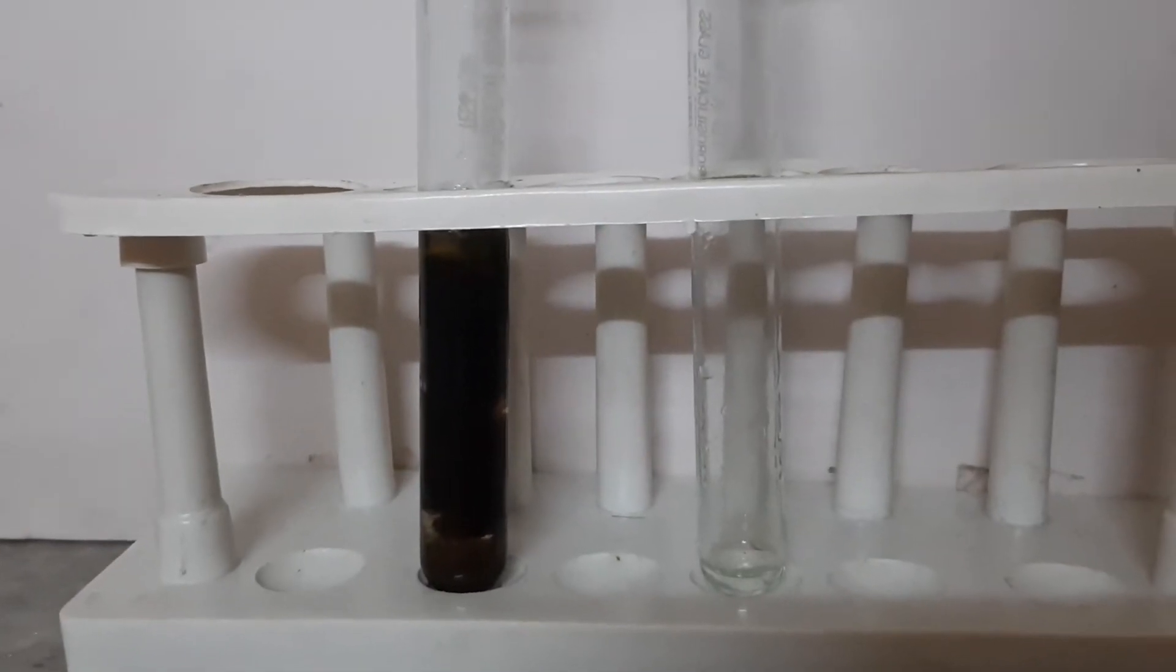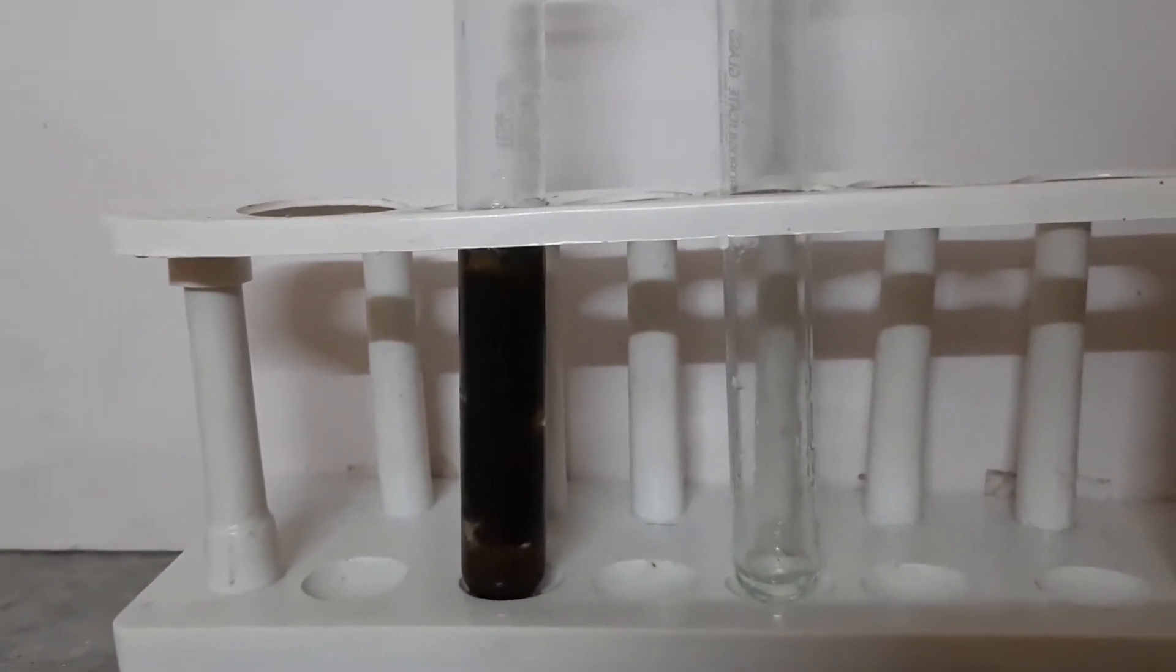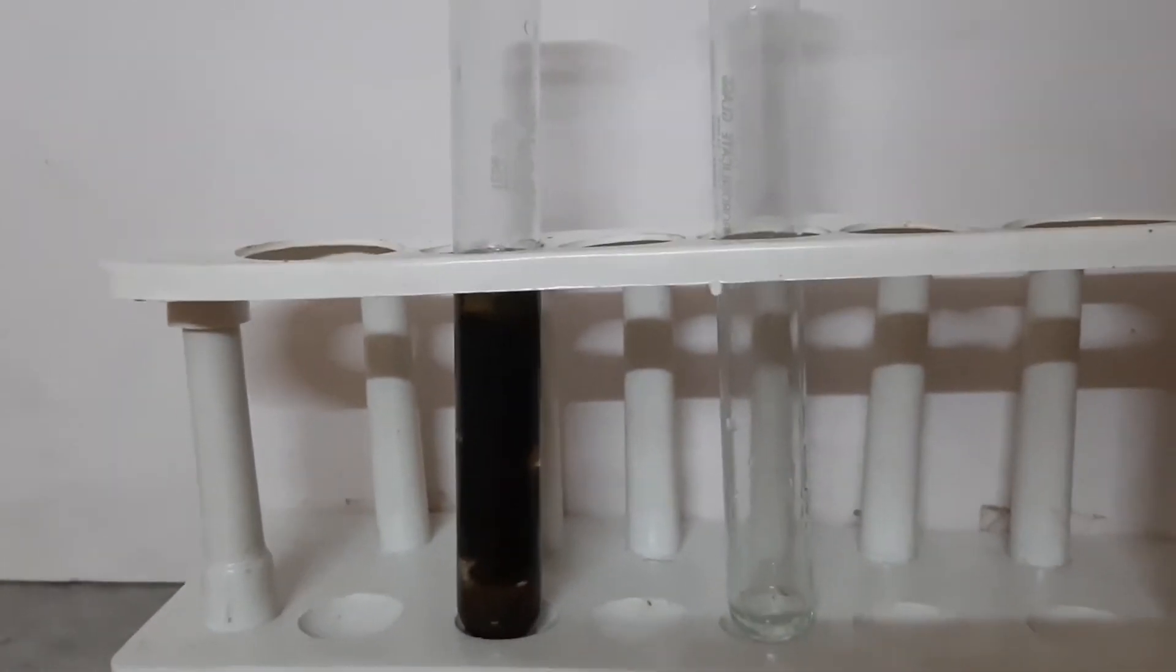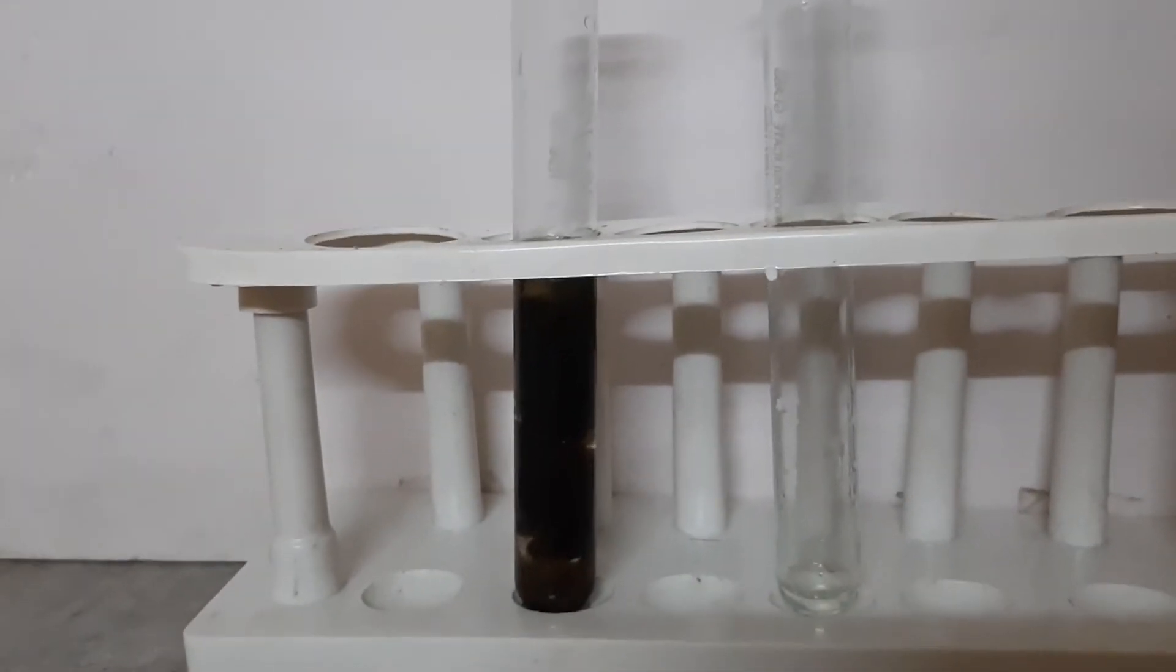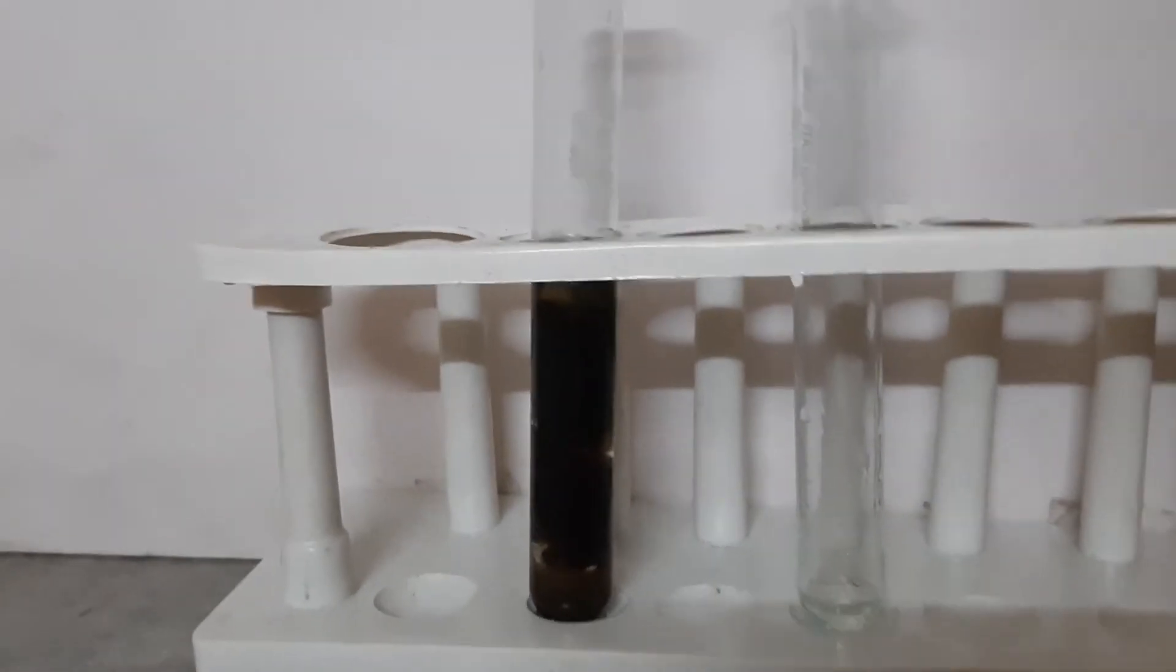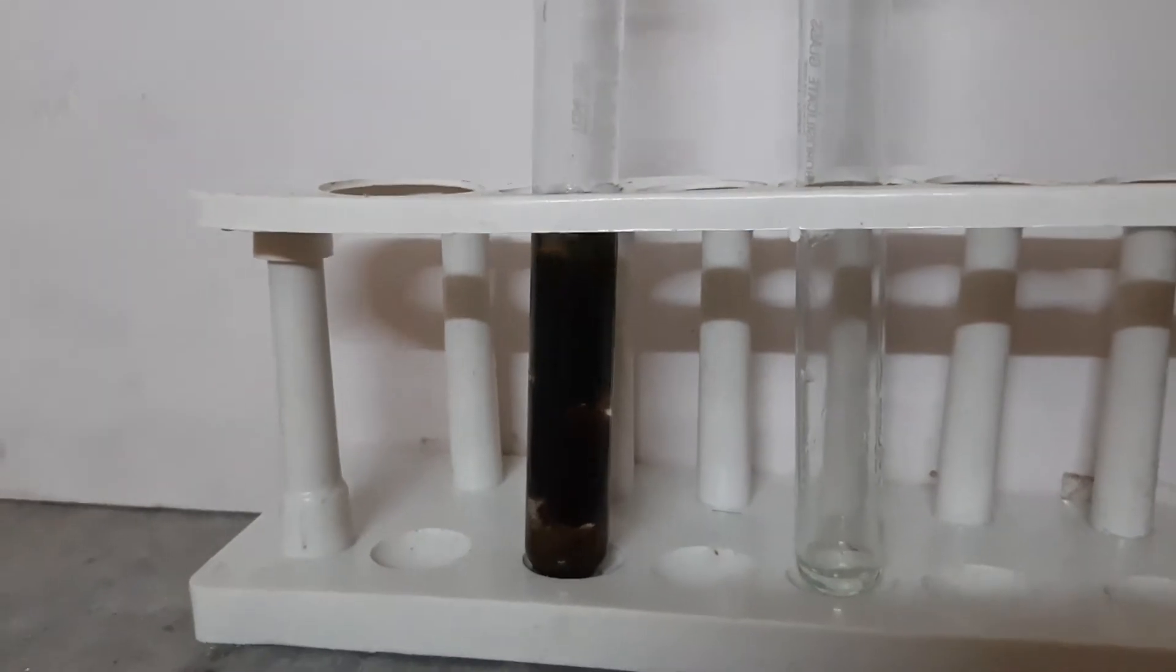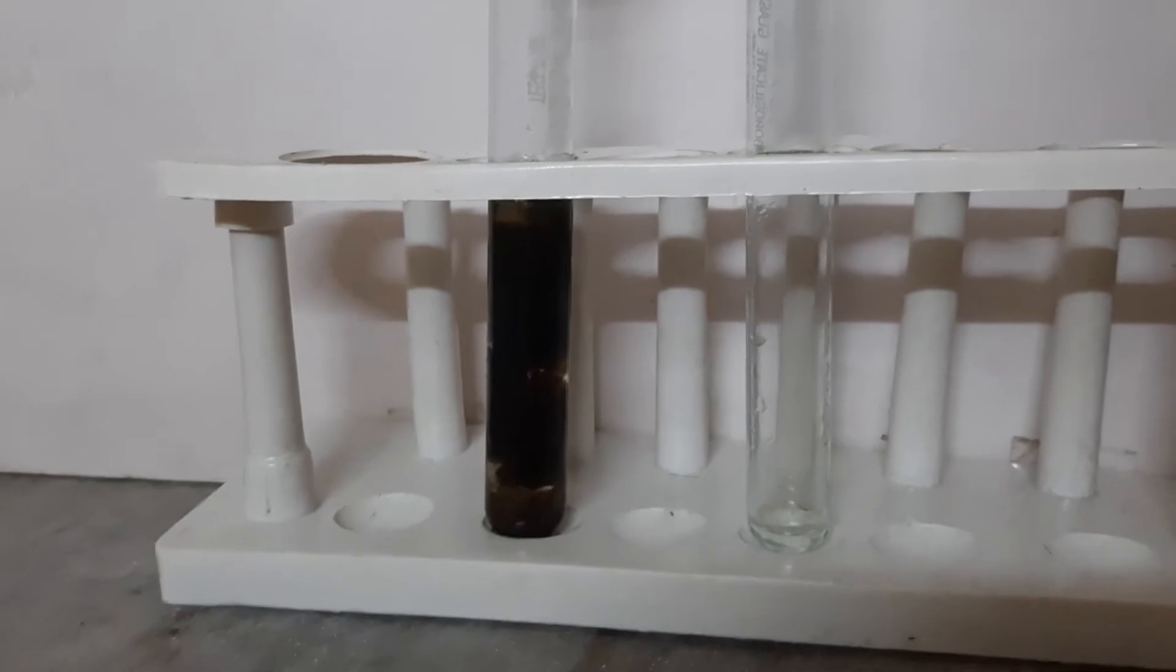Watch the solution very carefully. As you have seen, ferrous sulfate was slightly greenish-yellow in color, and on addition of sodium hydroxide, it turned into a pale green or dark green precipitate. This precipitate is basically iron hydroxide, which I'll be explaining very soon.